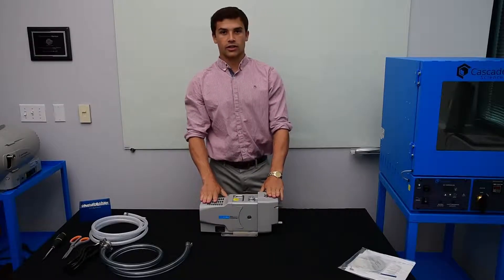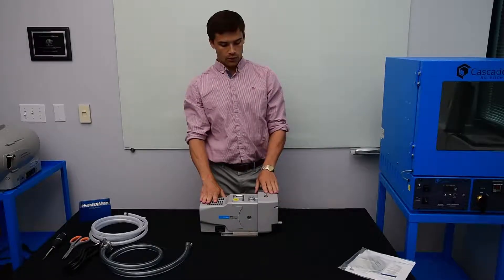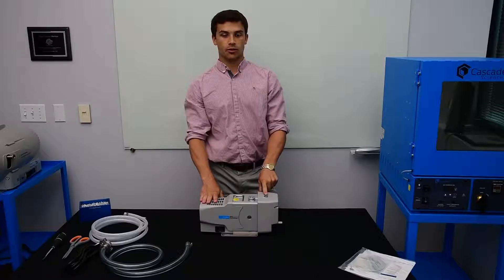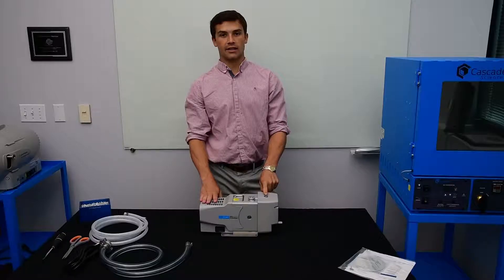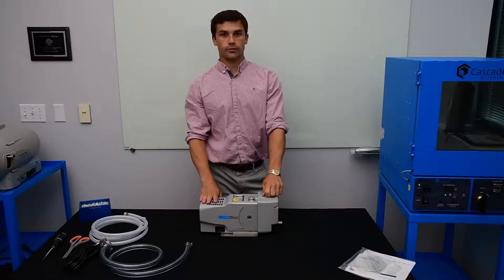Here is our Agilent IDP3 scroll pump. You want to make sure that the gas ballast breather kit is installed here. If this has not been done you'll want to use a flathead screwdriver to switch it out.